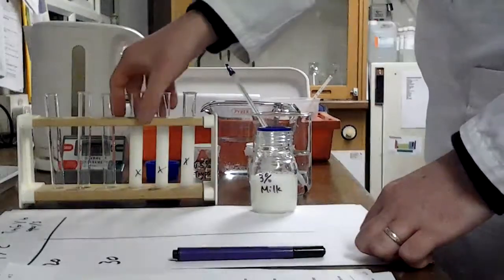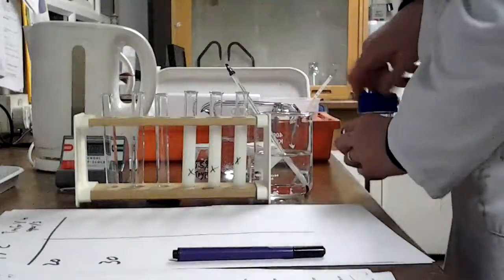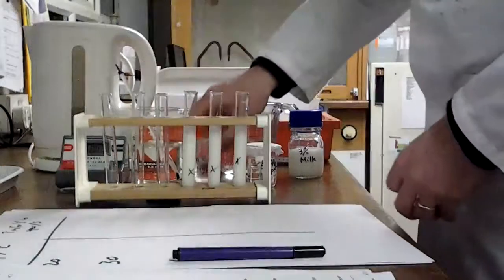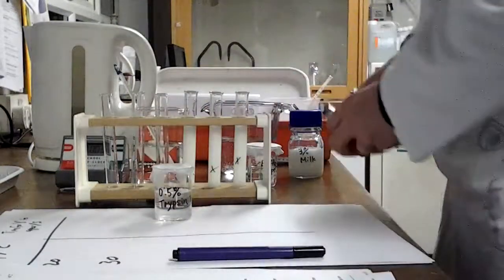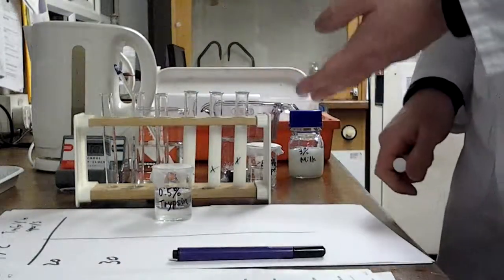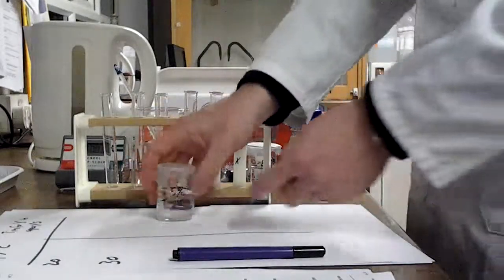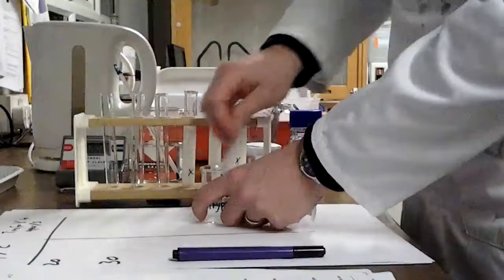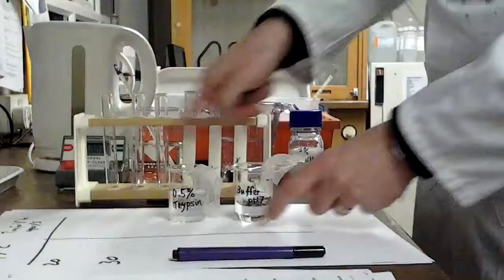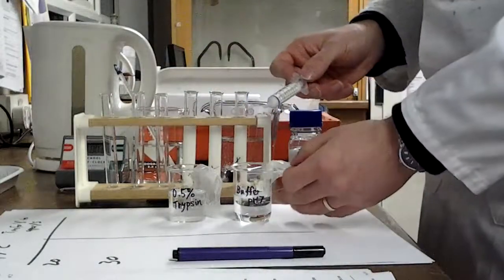So now what we're going to do with the other 3 test tubes, these 3 here, we need some other things. And these things we're putting in here are to make sure that the enzyme is operating in constant conditions. So if you think about the factors that affect enzyme action, temperature, well, we're already controlling that and changing it. What else affects them? Well, substrate concentration, well, I've controlled that in here because this is all the same milk solution. But pH is important. So I'm going to use a buffer alongside my trypsin. So here's the buffer, and it's a pH 7 buffer. So it's going to keep the pH in all of these test tubes, when we mix it together, at 7, and it's going to stay there, which is good.